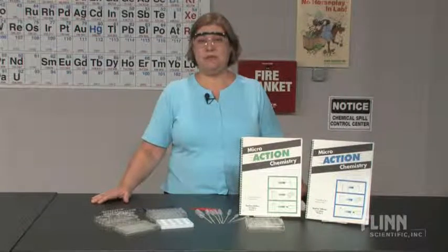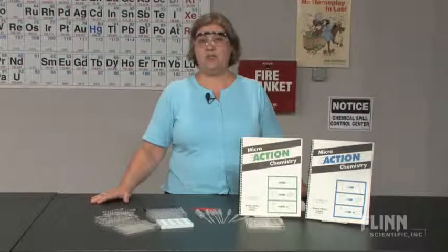Safety always comes first. Ventilation hazards and the risk of spills are reduced or even eliminated. Microscale labs take less time to set up and organize, so you can devote your energy to supervising students and helping them succeed.